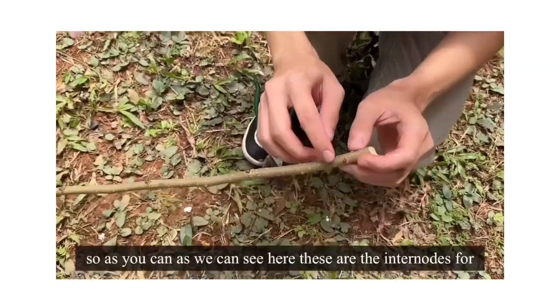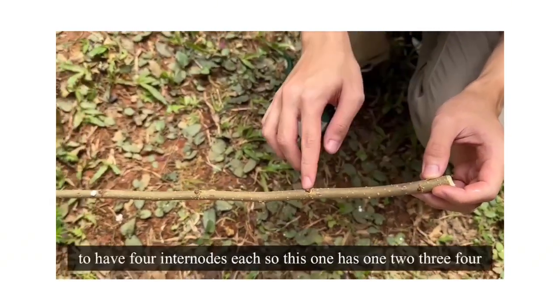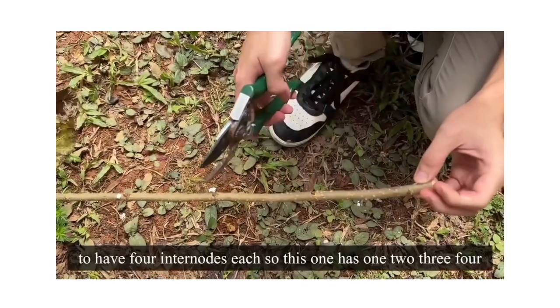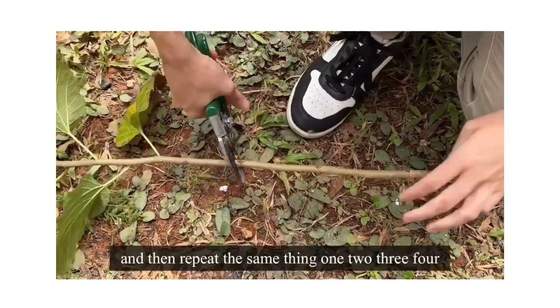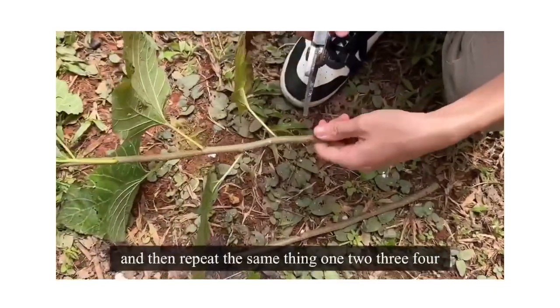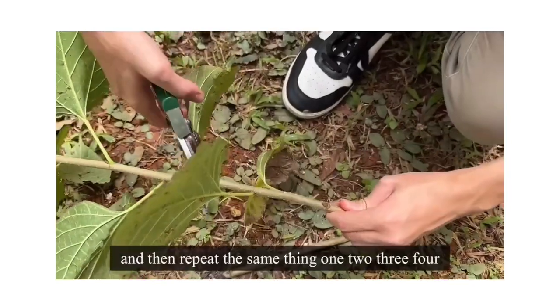As we can see here, these are the internodes. For each stem, we need to have 4 internodes each. So this one has 1, 2, 3, 4. So we cut here slantedly. And then repeat the same thing. 1, 2, 3, 4.